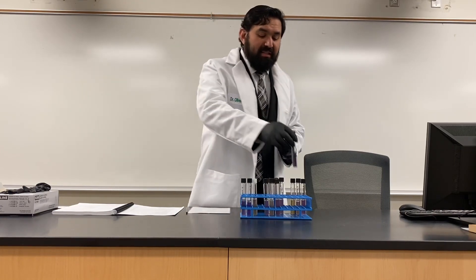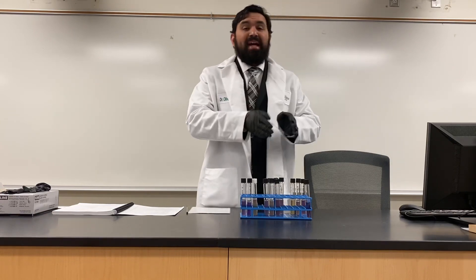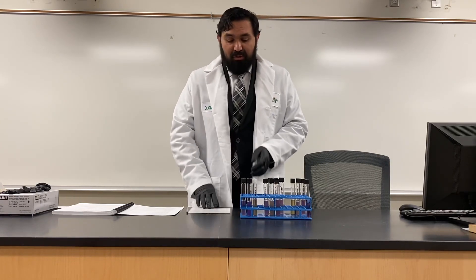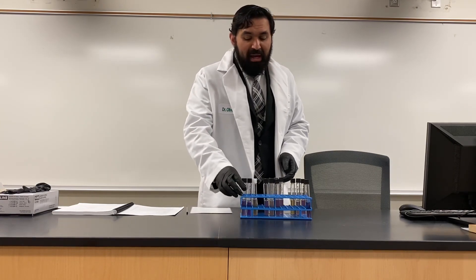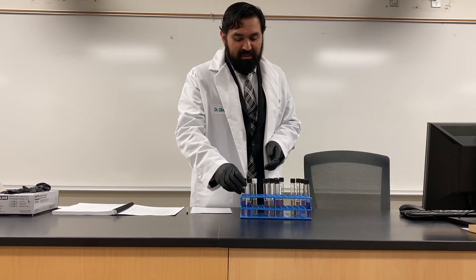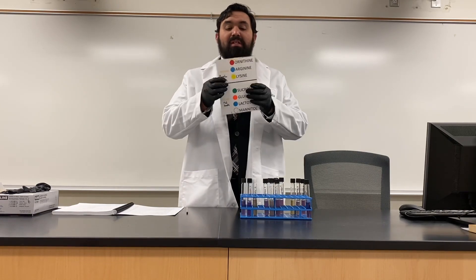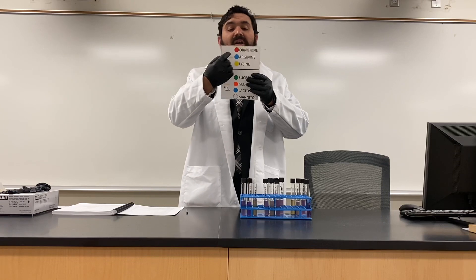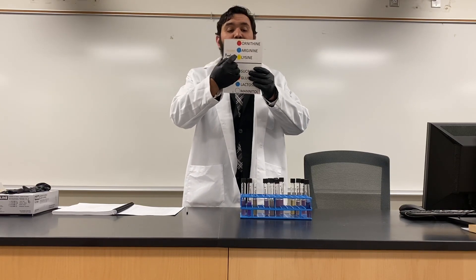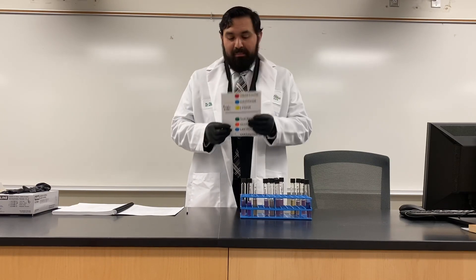We're going to test if these organisms can use a specific amino acid. On top of the amino acids, we have colored dots to let us know which amino acid is which. The red dots contain ornithine, our blue dots contain arginine, and our yellow dots contain lysine.